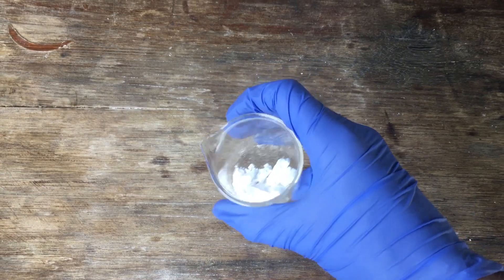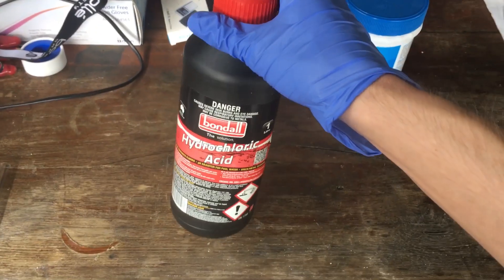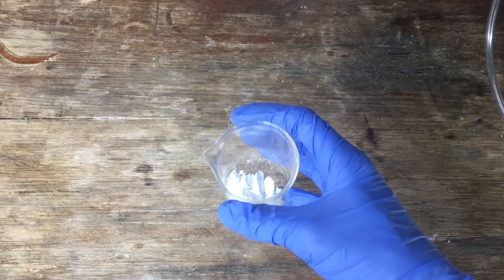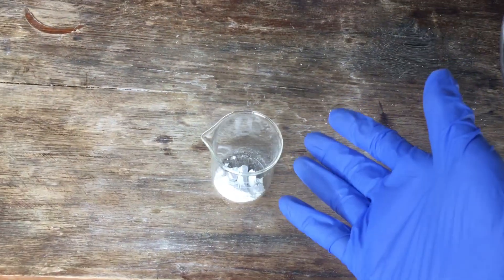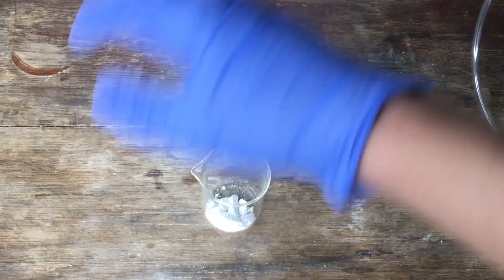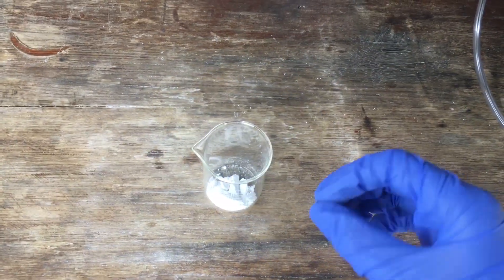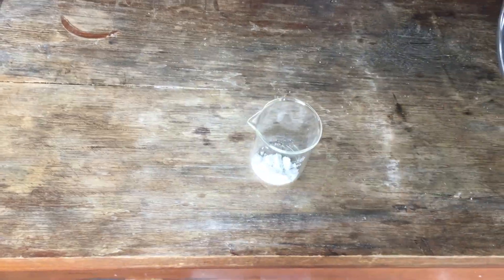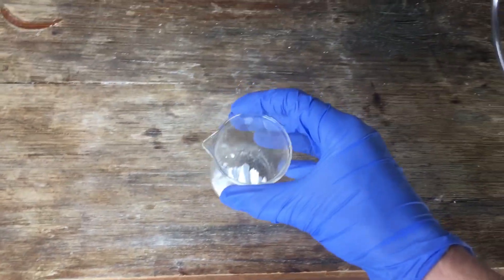You can see I have a little bit here. This is about 7 grams, which should be enough to react with around about 10 milliliters of concentrated hydrochloric acid to generate a bit under a liter of chlorine gas. Which is way more than we'll need, but consider the fact that when we build an apparatus, we'll need to flush the whole apparatus out with chlorine, make sure all that chlorine is pure, and then put the chlorine into our ampules. So we do have an excess.